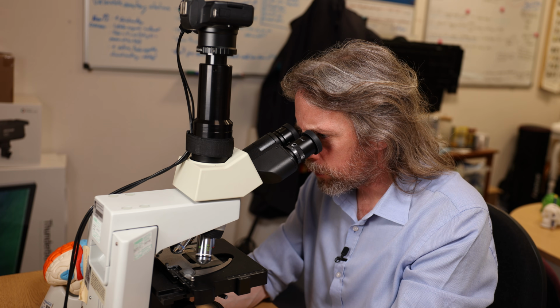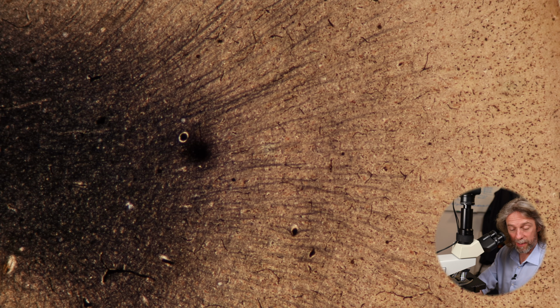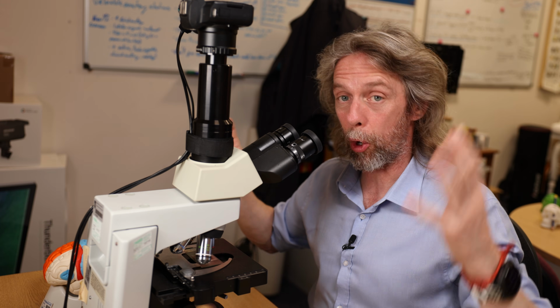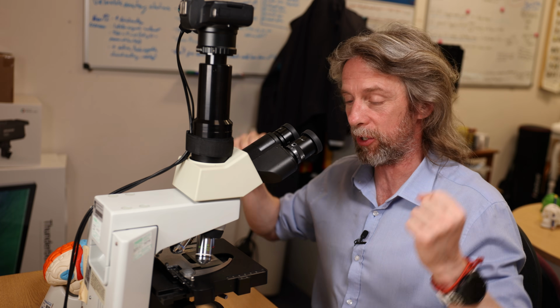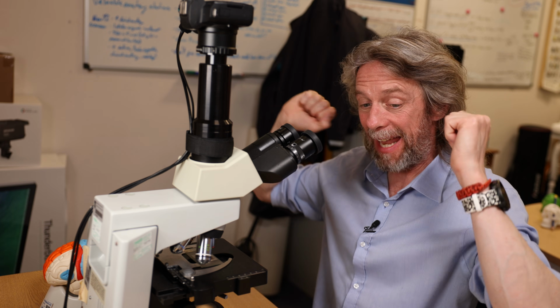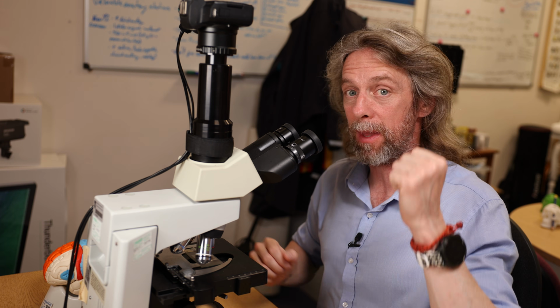So again, like much of the histology we've been looking at, and particularly with the nervous system, you have to imagine a lot of the microscopic and cellular stuff. By looking at the cells and the organisation, hopefully that helps your imagination, or you have to imagine less. That's the organisation of the cells in the cerebrum.